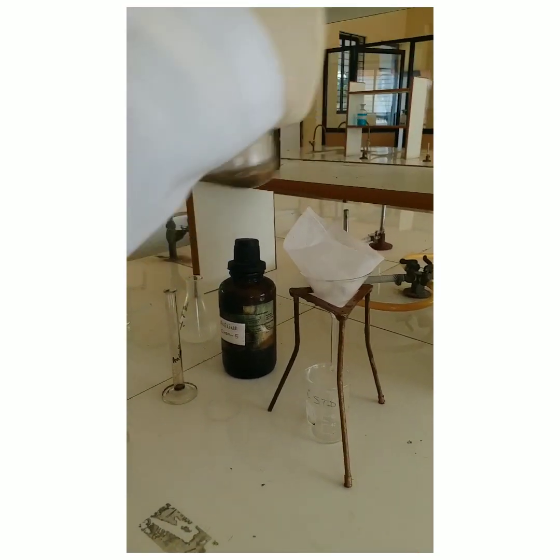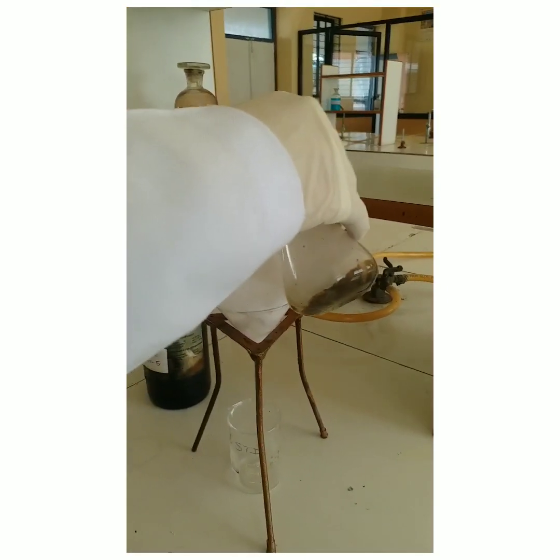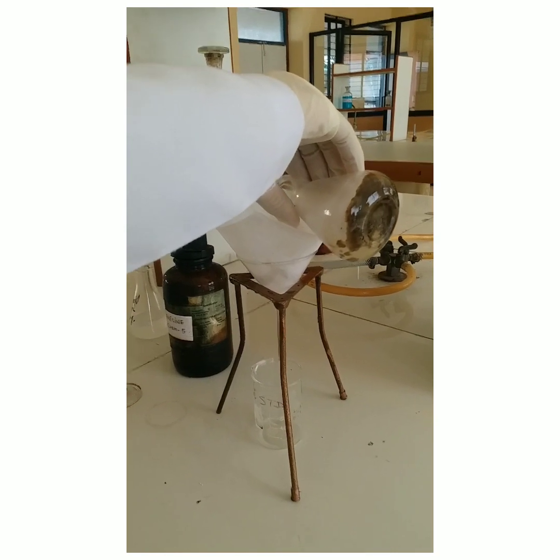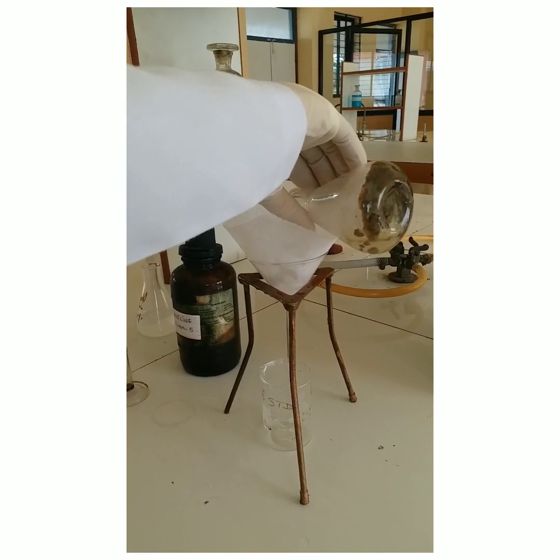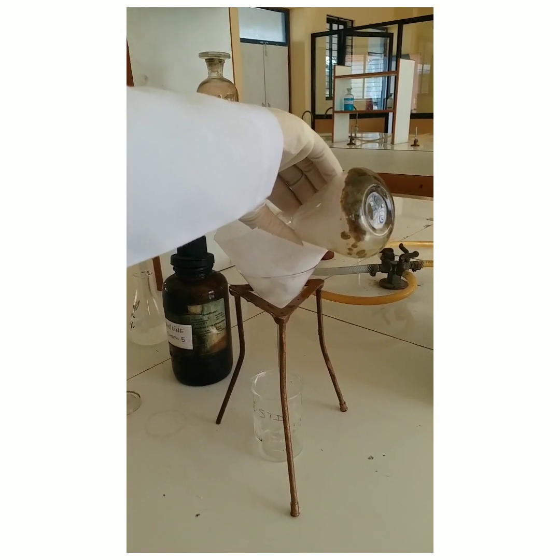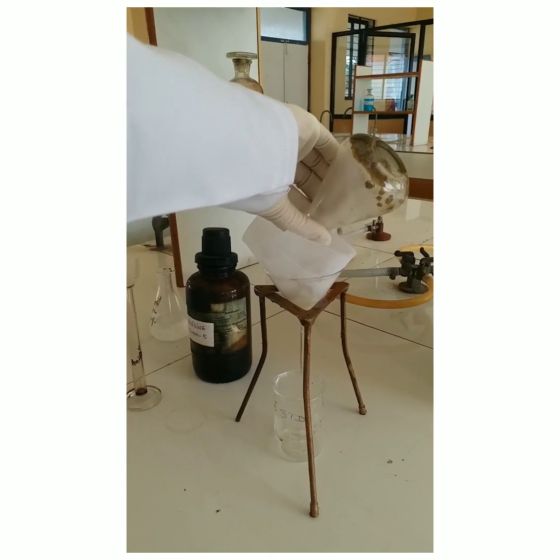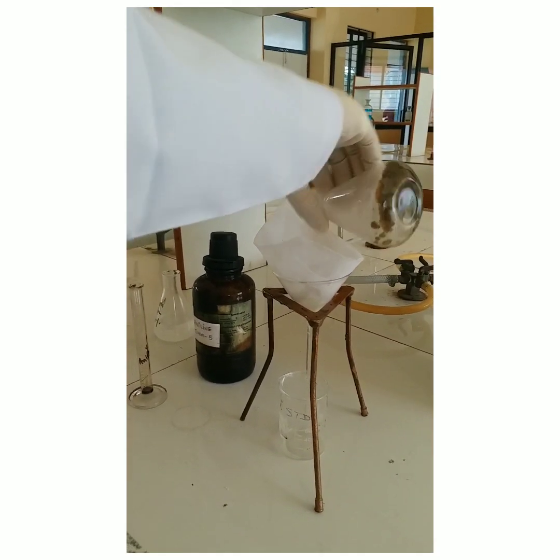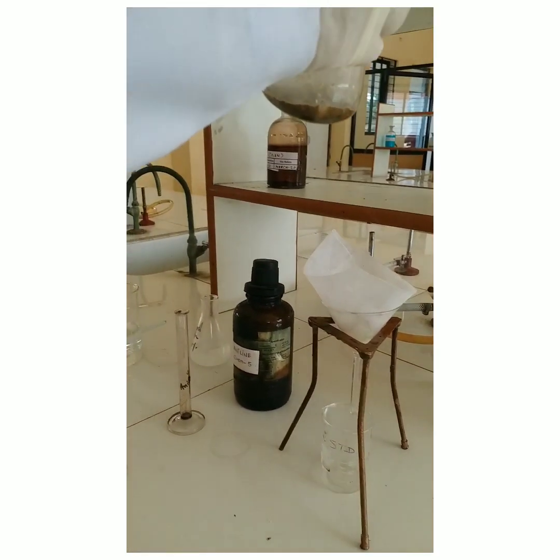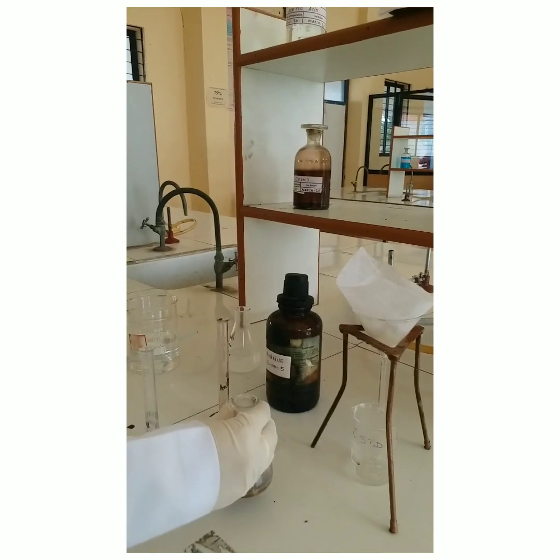Rinse the filter paper using a funnel and filter the product. Wash the product using distilled water.